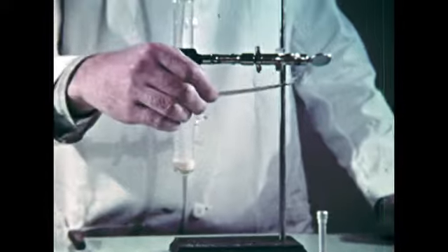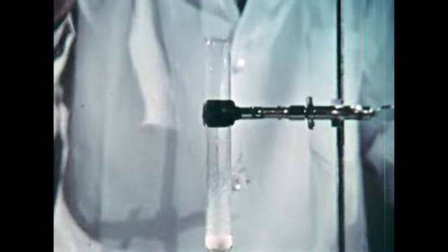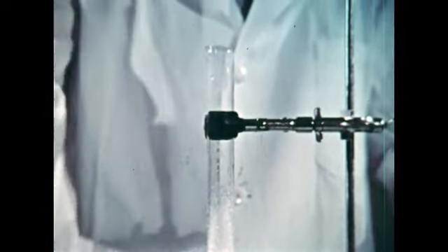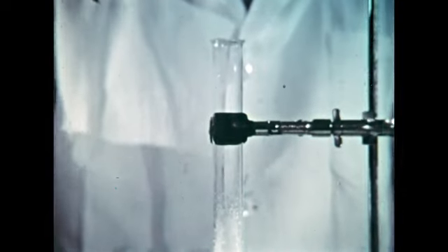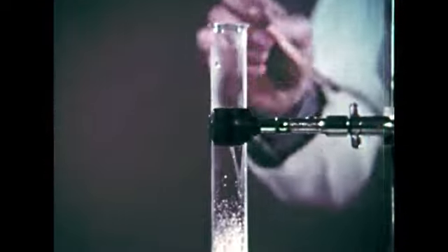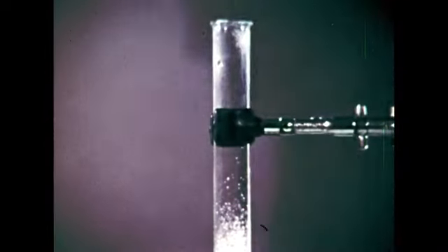We'll test for it by the traditional method, combustion, which itself is one of the most useful chemical reactions. The oxygen ignites the ember that air will not. The successful repetition of the test shows that there is more oxygen in the test tube, and we can infer that the reaction is still taking place.